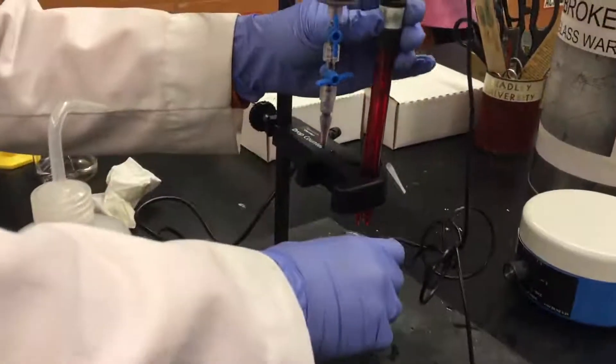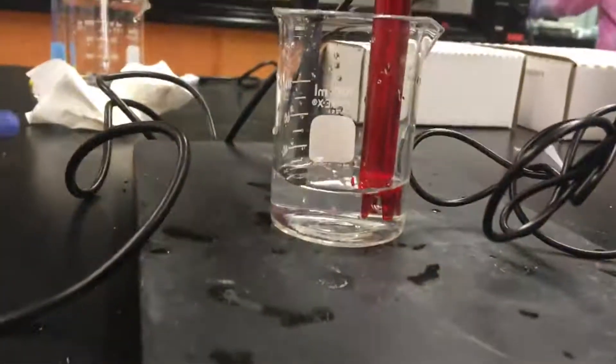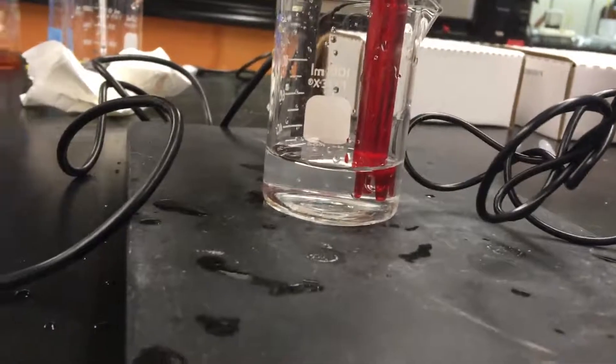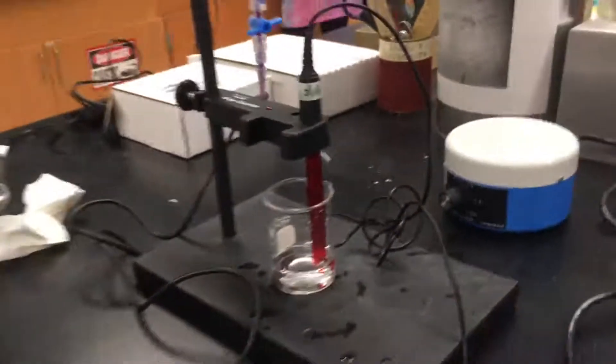So now it's good to be put in the sample, so the sample will go underneath. And then you want to make sure that the probe doesn't touch the bottom of the glass. So everything looks good there.